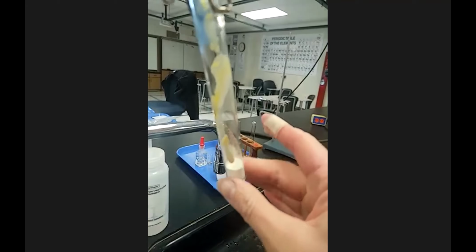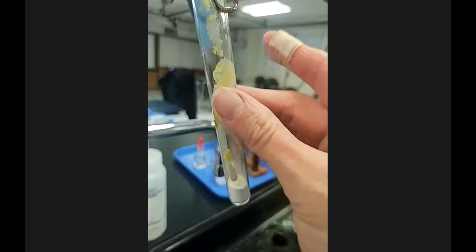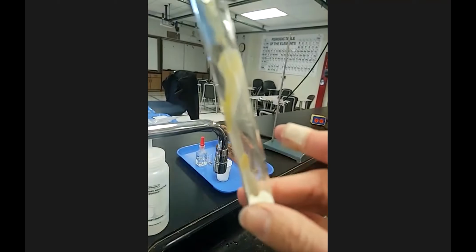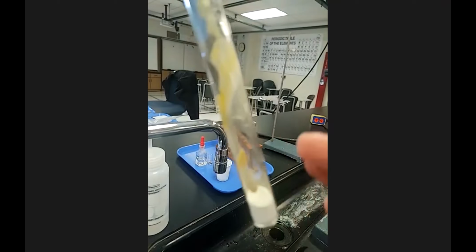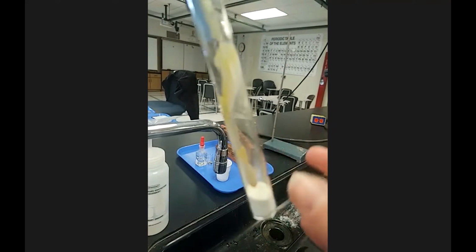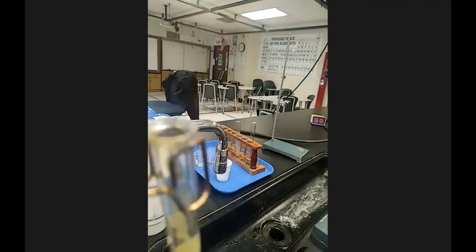This is warm, but not super hot. As long as it's cool enough to touch and hold, and it's not quite that yet, but you guys will wait. If it's cool enough to touch and hold, then it would be cool enough to clean out.